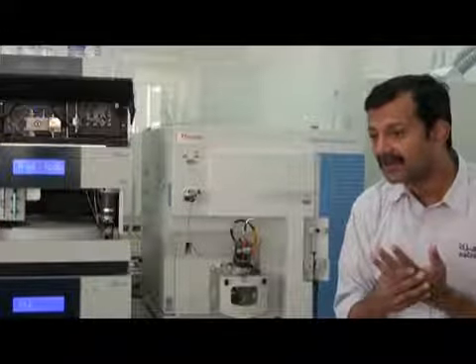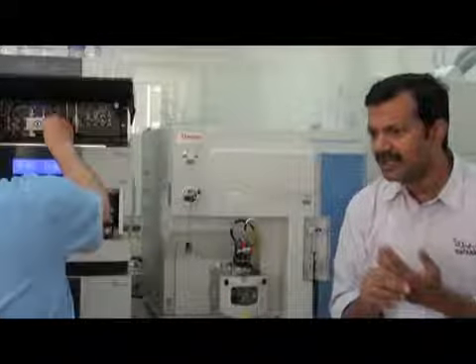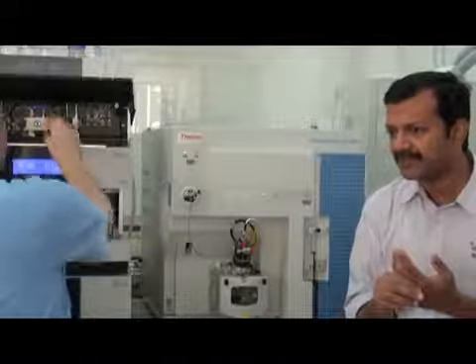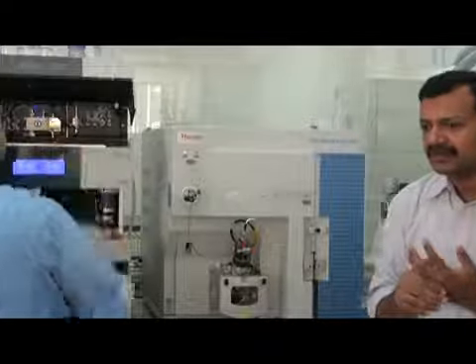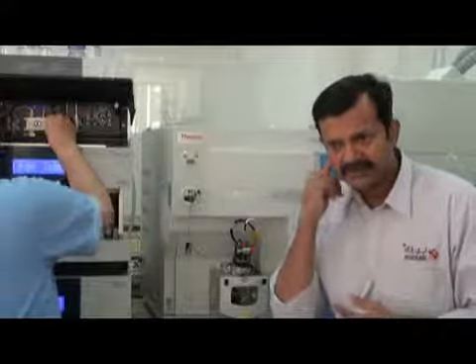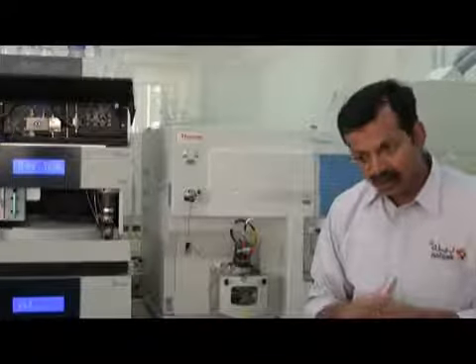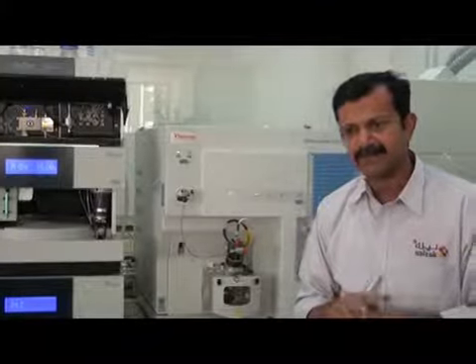Because if we use another mobile phase, we will get new bubbles and the same problem. I don't like that. Repeat: the goal of purging is to remove any bubbles. Yes, okay? To remove any bubbles. Okay, I remove it by A.